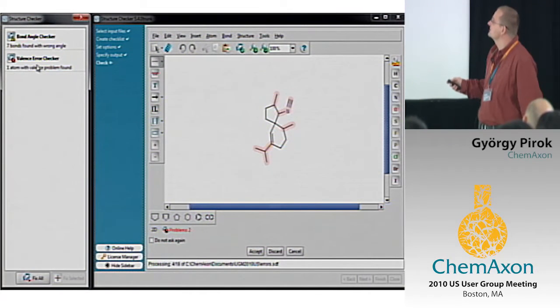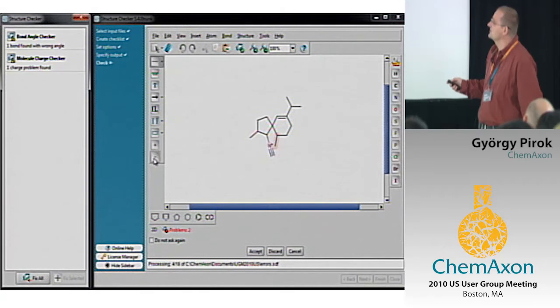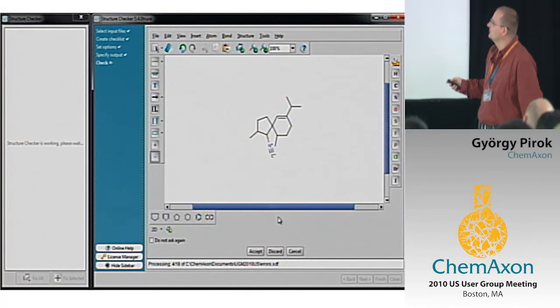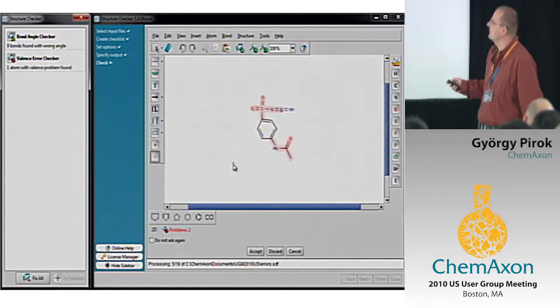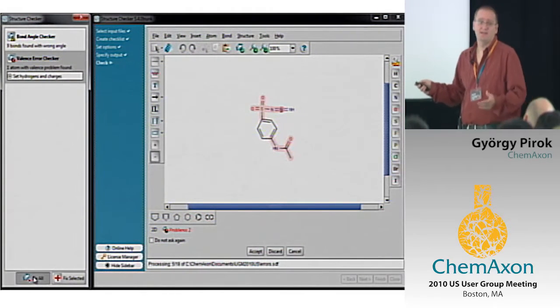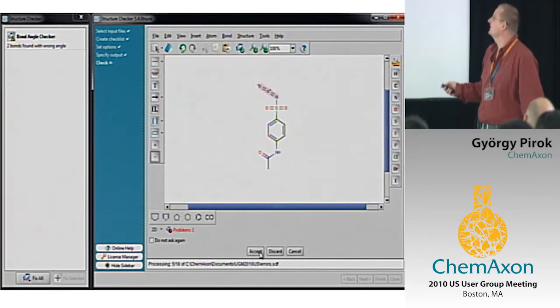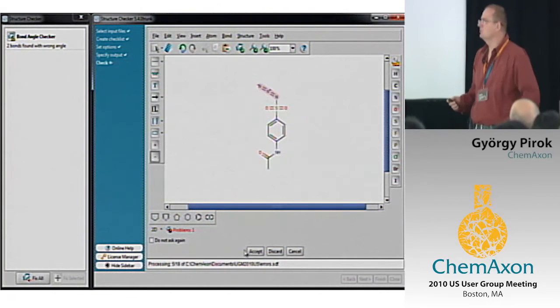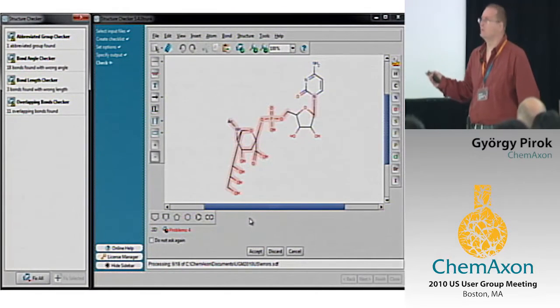Here we have some others, not just bond angles and bond lengths, but here is another issue. The charge was added automatically, and I added manually another charge which was missing because it's probably an isocyano group, and we accepted it with an error because there was a kind of crowded bond there, but we can accept it if you like it. So this is when you can manually interact with the tool and do the registration in a controlled way.